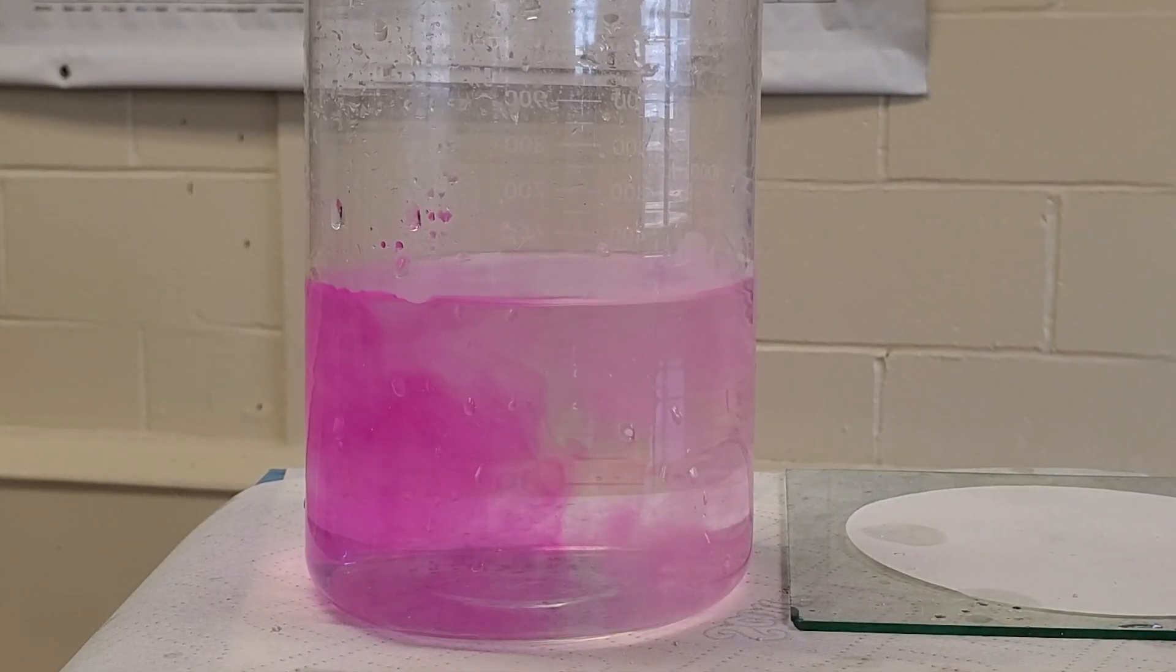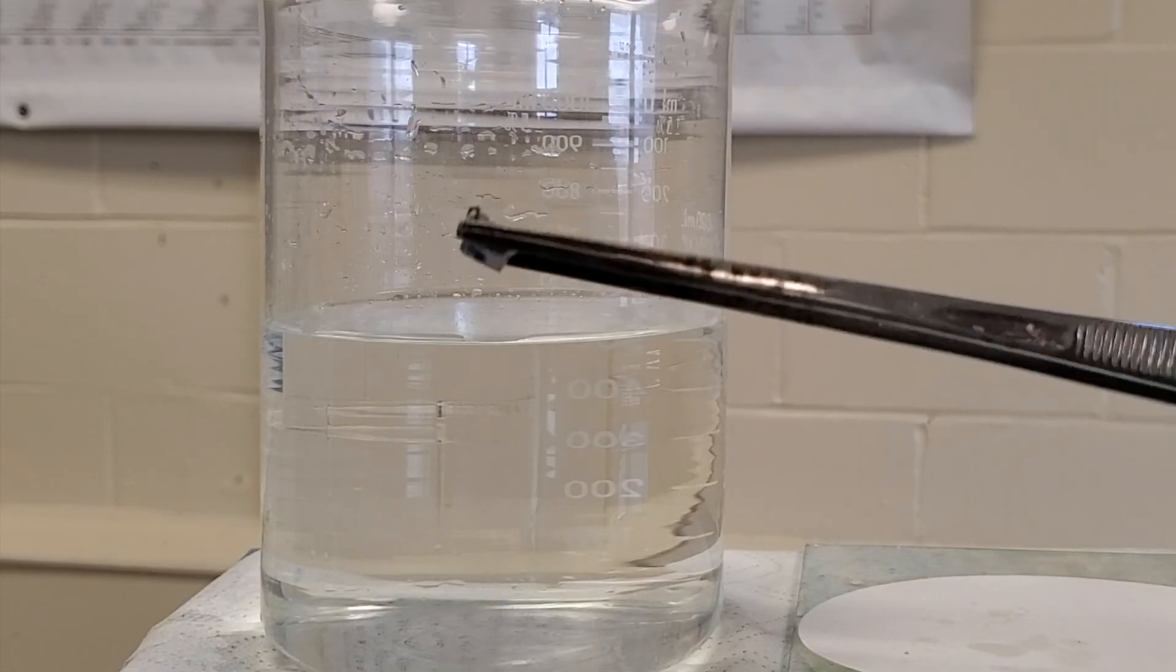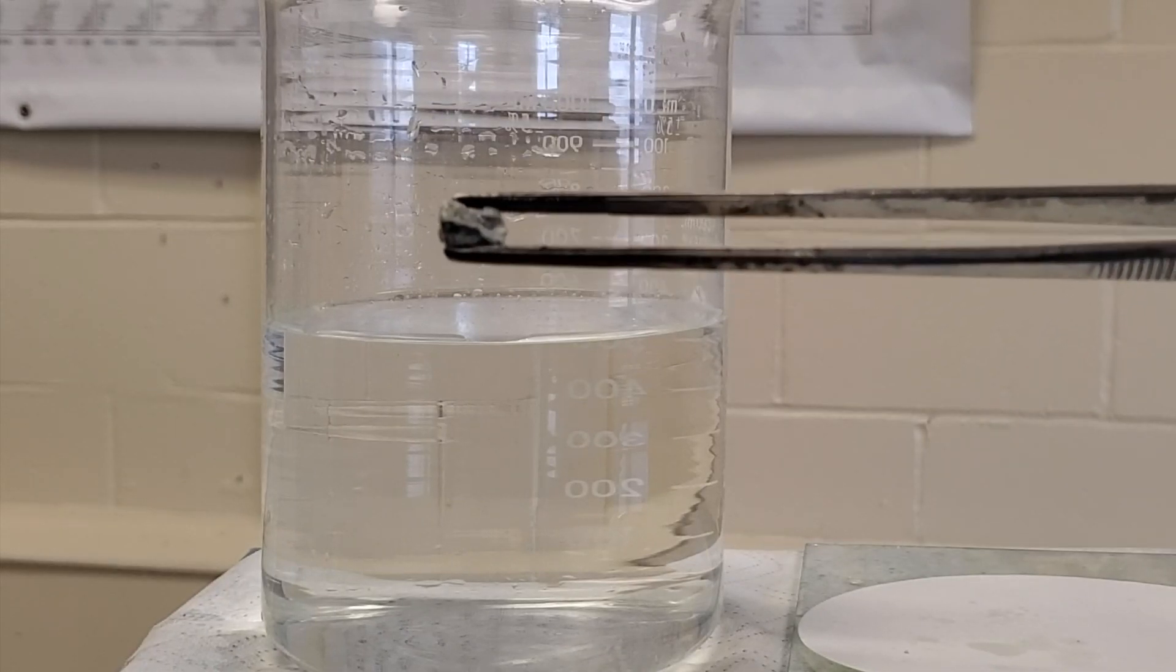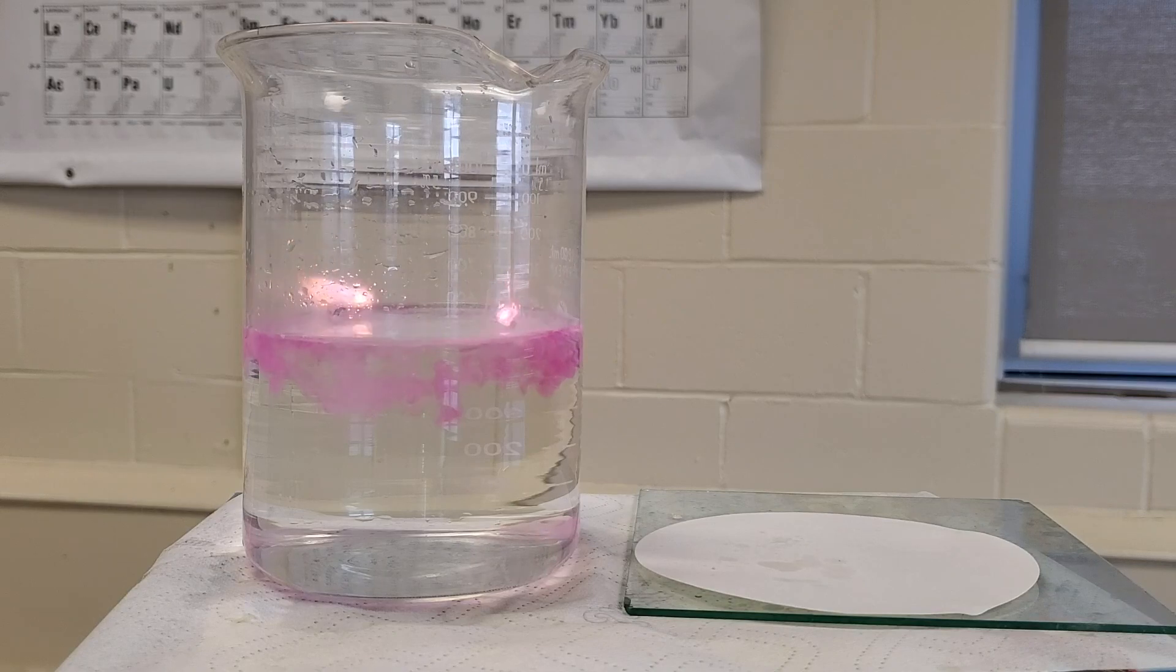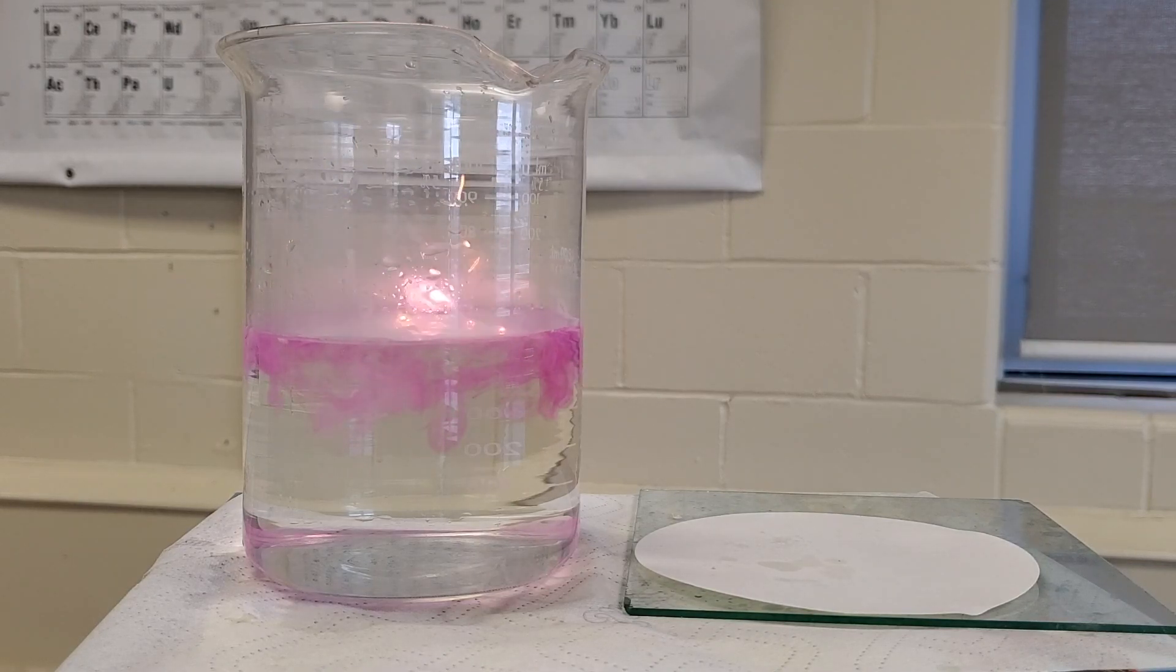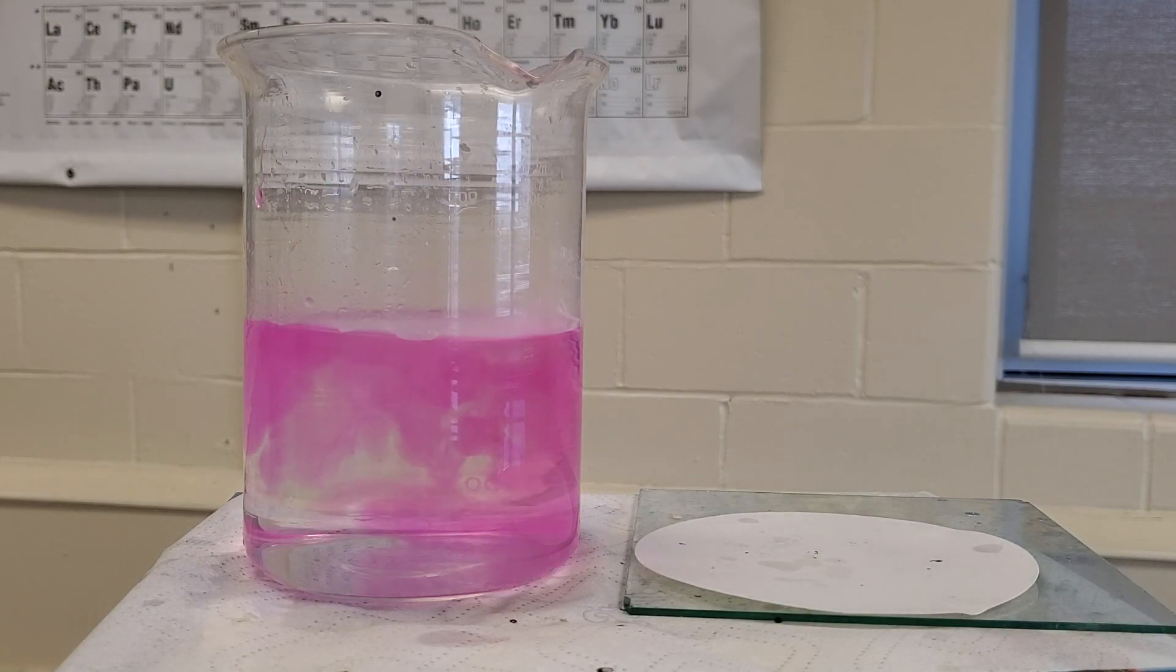I wonder how potassium will react. Okay, now potassium. Notice again in that short time, it's no longer shiny because of its reaction with oxygen. Let's drop it in. Did you see how reactive that was? It's even more reactive than sodium. The instant it touched the water, it catches fire and then explodes.